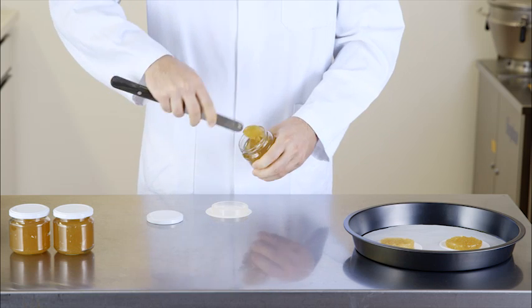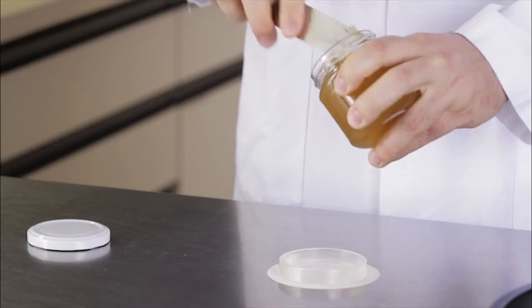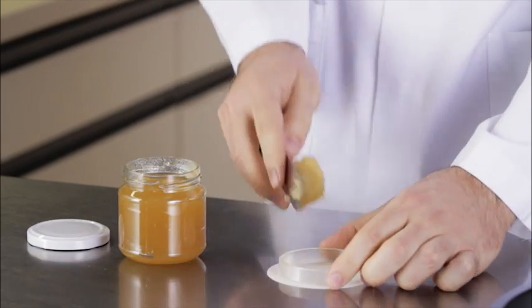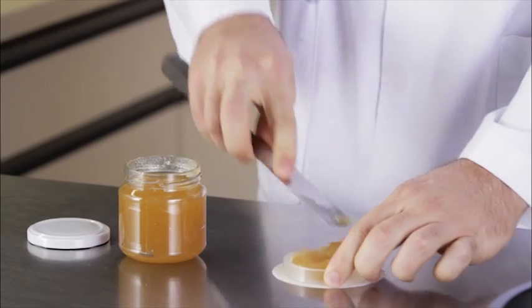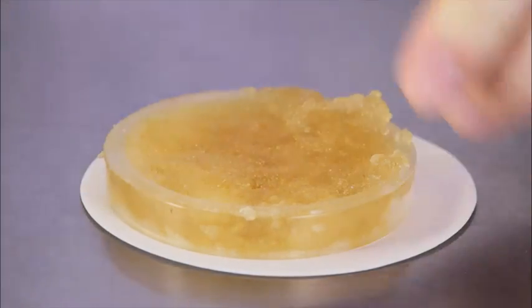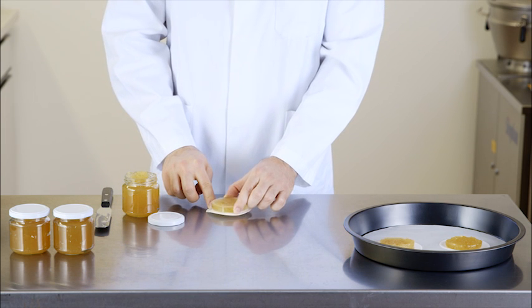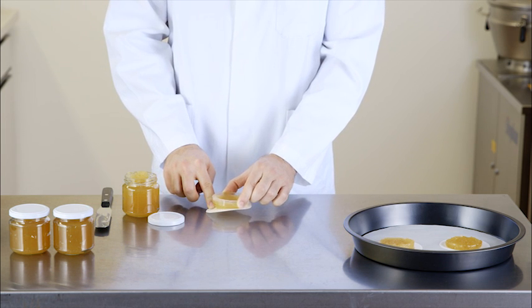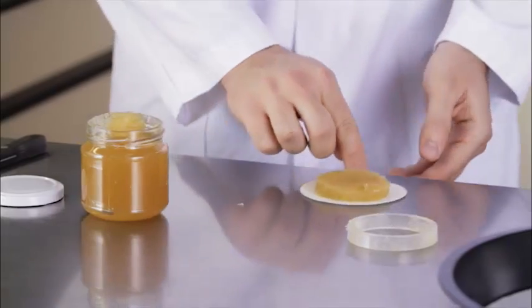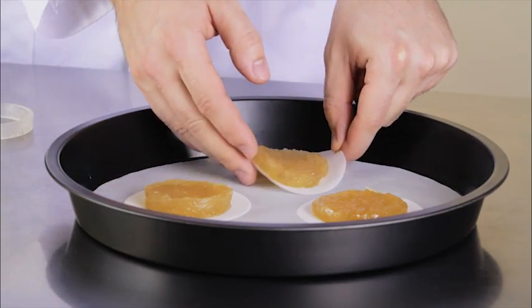In preparation for the baking test, the preparation is stirred and placed on the base with the aid of a ring. Then the ring is carefully removed, ensuring that the pre-specified form is not altered, and the baking preparation is placed on a baking tray.